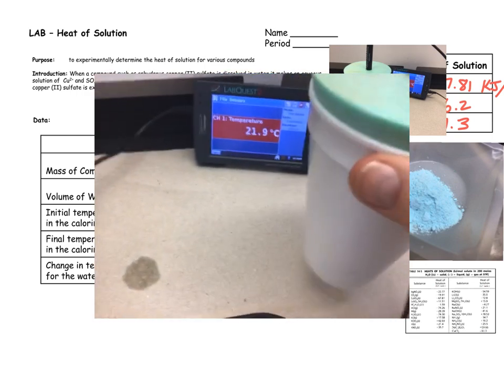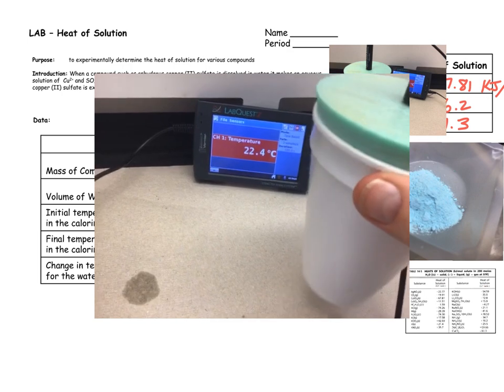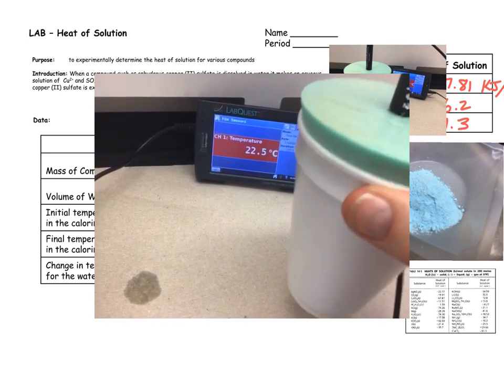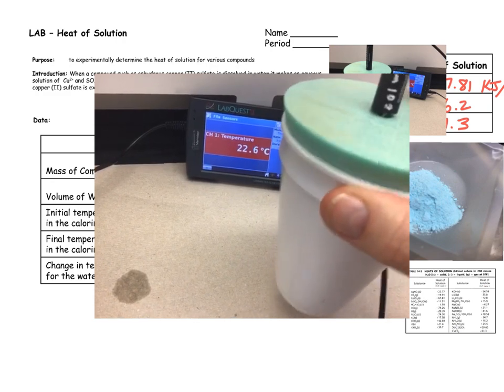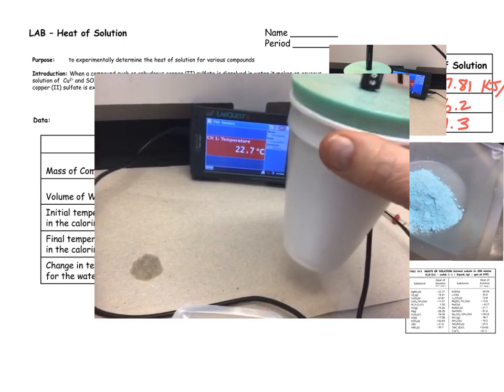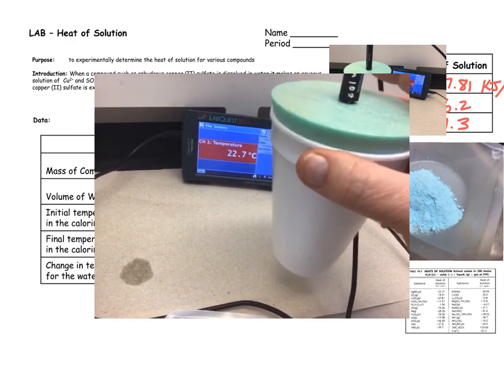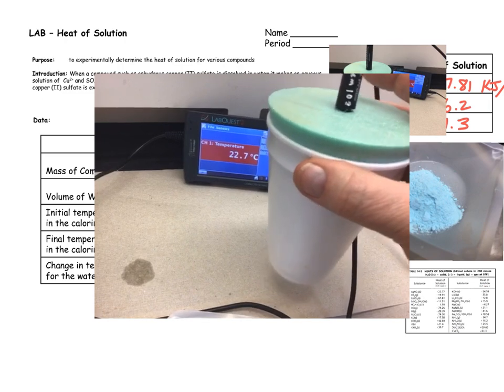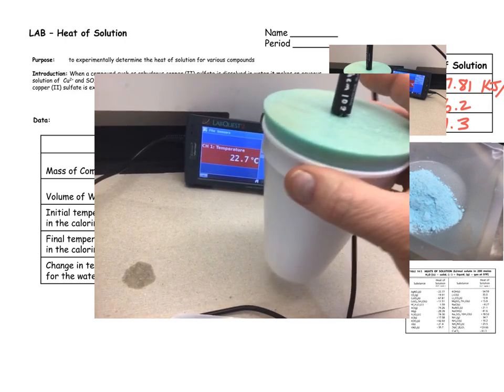Now, the temperature is increasing, which is what we expect because the theoretical value is a negative number, meaning that this is exothermic and it will add heat to the water. All right, give it a second.